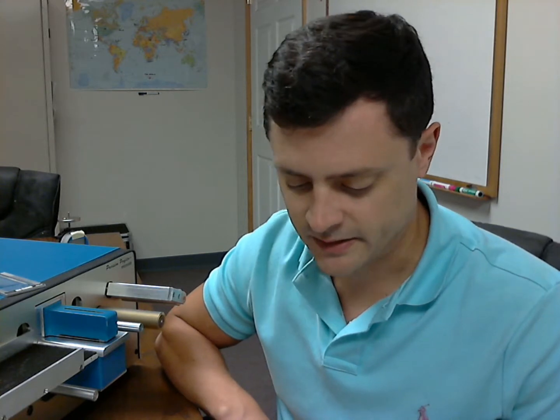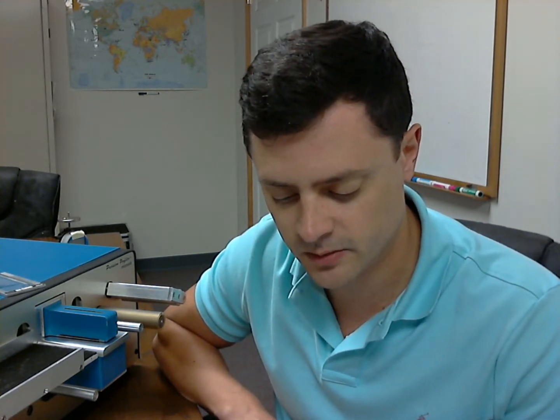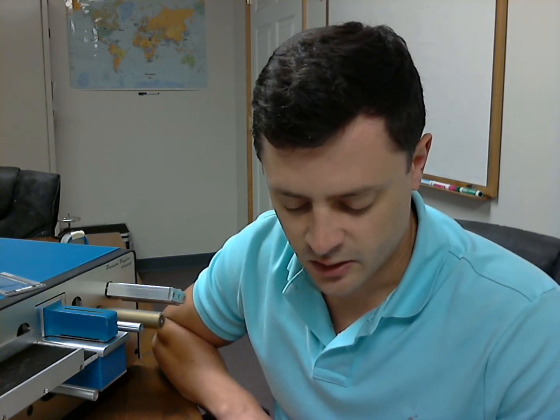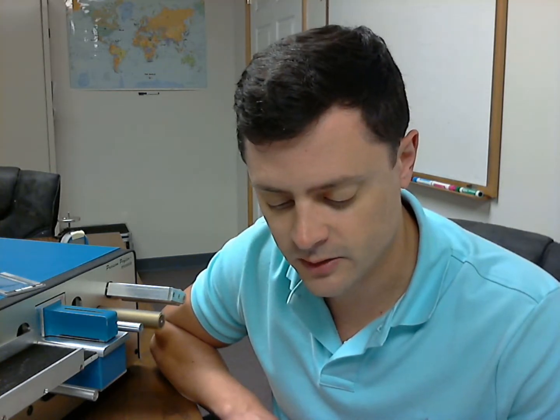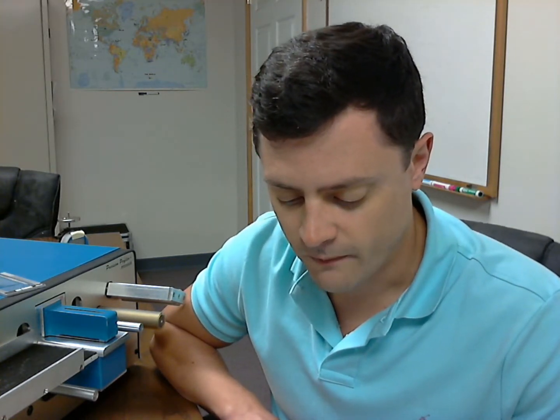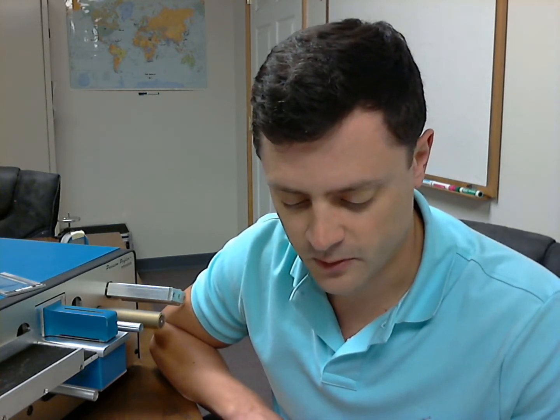6.1 says a non-contact capacitance thickness gauge that is linear to plus or minus 0.5% over the thickness range of materials being measured, as tested in accordance with Appendix X2 in its response, and exhibits a precision of plus or minus 0.1 microns or plus or minus 0.5% material thickness, whichever is larger, when used with the standard reference material.